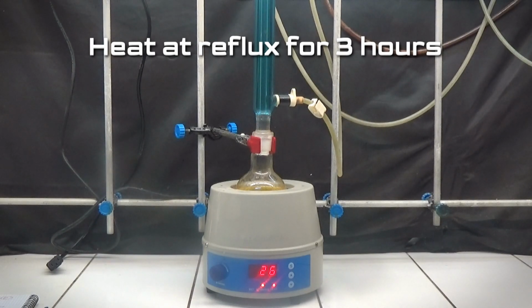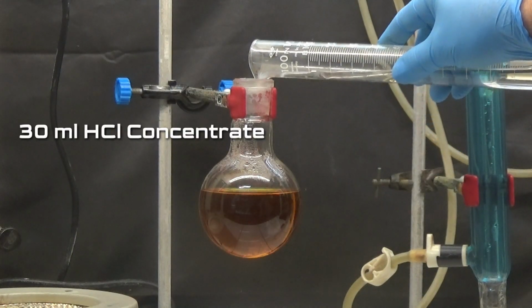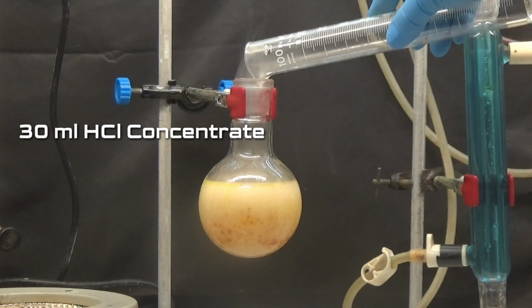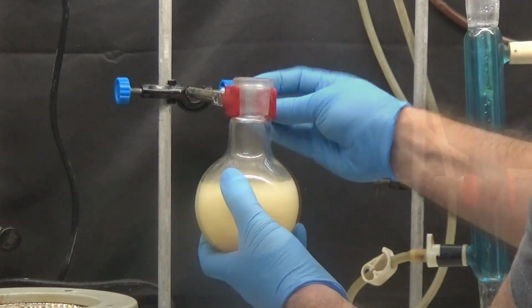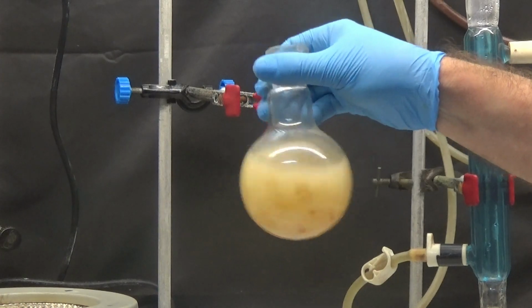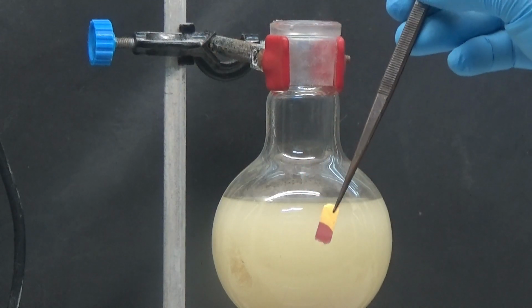The solution has a yellow color during the heating. All the solid is dissolved. After 3 hours of reflux, let the solution cool and add 30 milliliters of concentrated hydrochloric acid. Check the pH to make sure that the mixture is acidic.